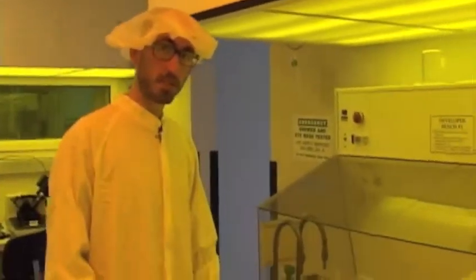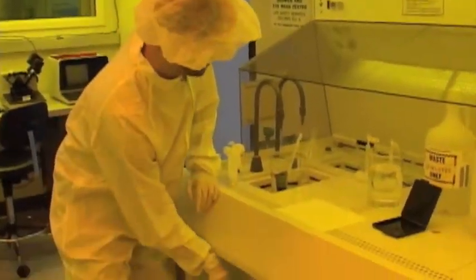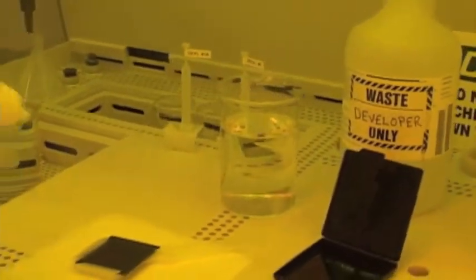Now we're done rinsing, so I'm going to turn off the water, take out the mask, and dry it off.